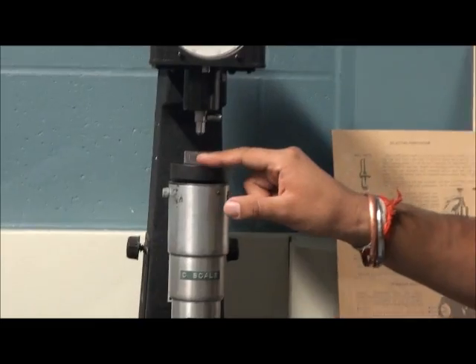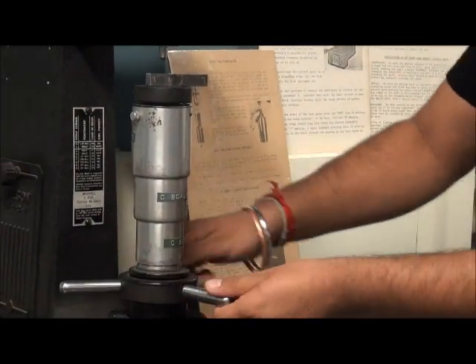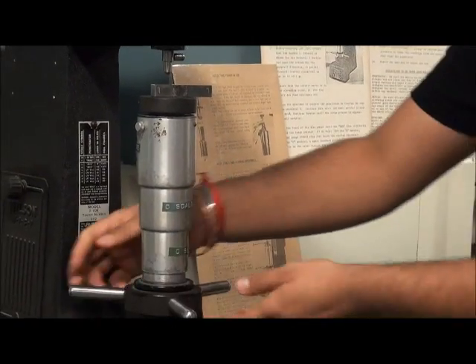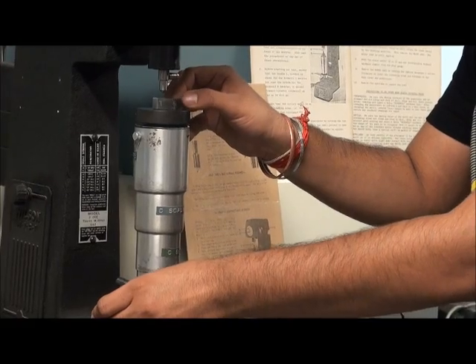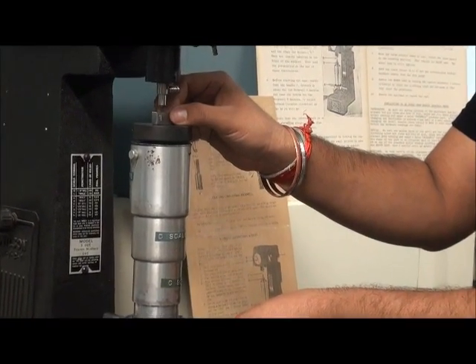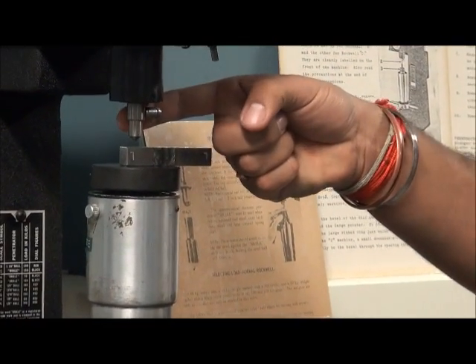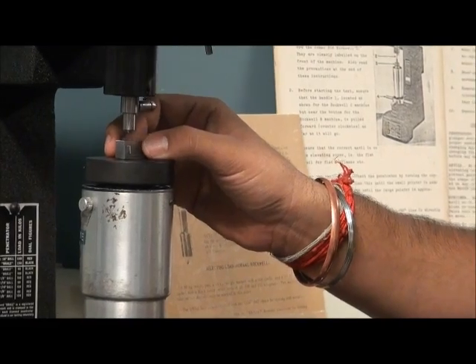As we place the base metal, we move the wheel in the upward direction. This is the diamond indenter which measures the hardness of the harder material.